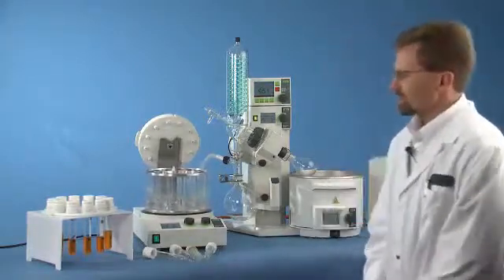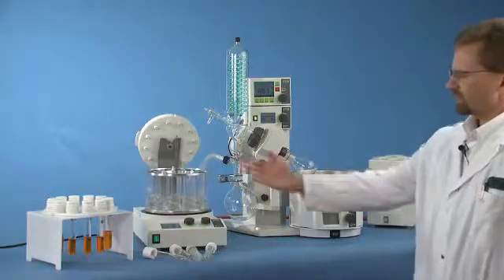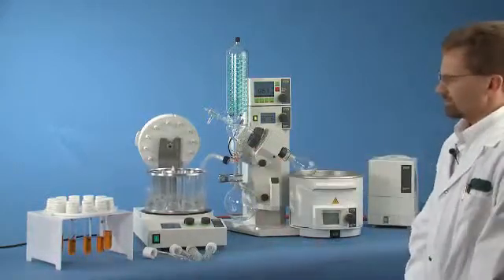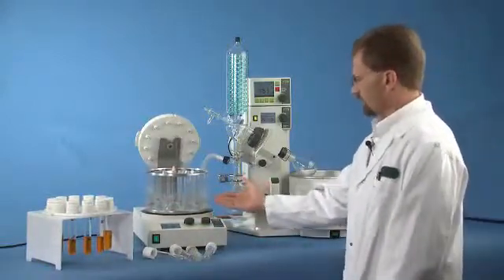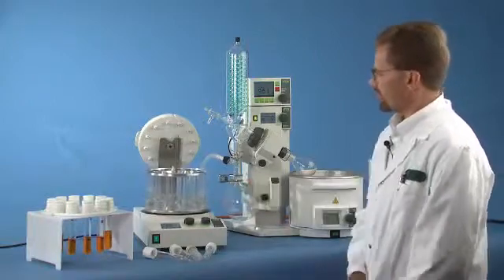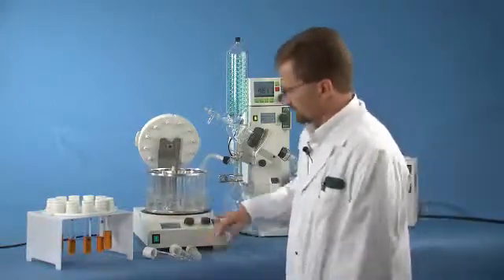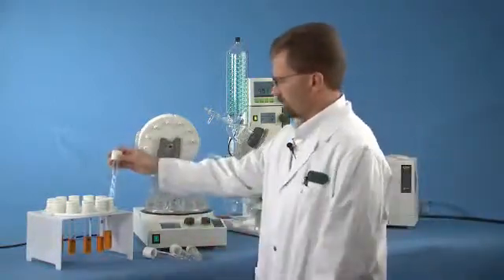For your sample workflow, you simply place the rack on the stand. You can prepare your samples. While you're preparing your samples, you could adjust the temperature of your water ahead of time. Simply take your vessel, prepare your sample, put it into the lid.